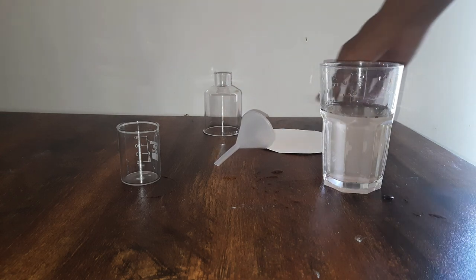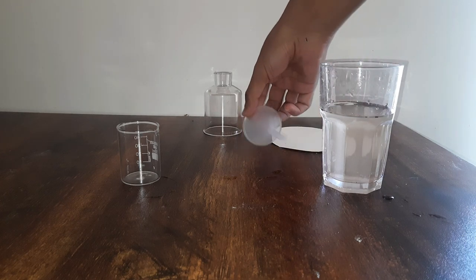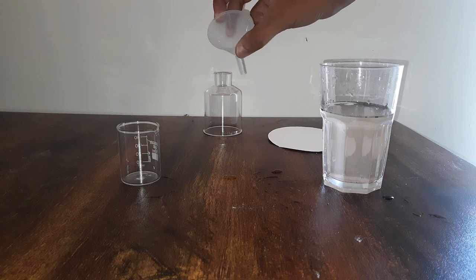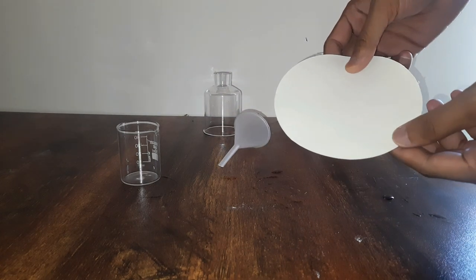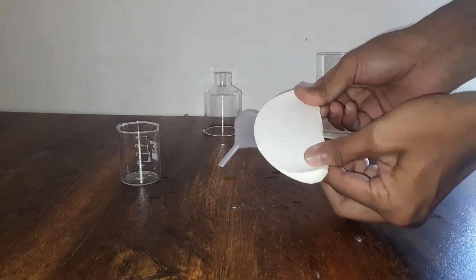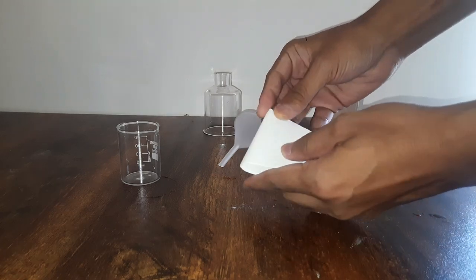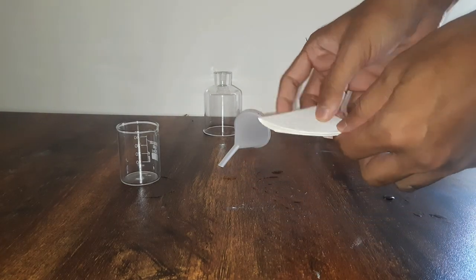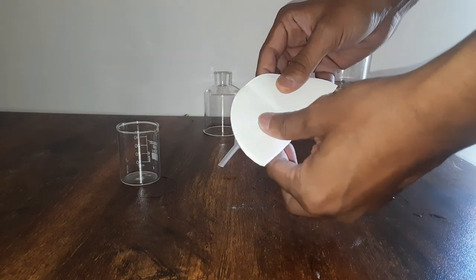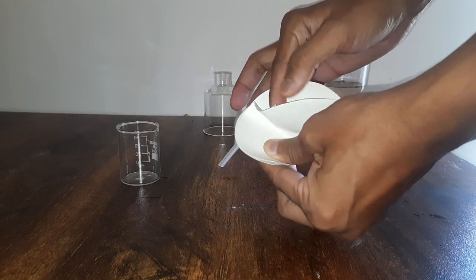As a first step, what we will do is fold this filter paper and try to fit it into the mouth of this funnel. To do that, we will first fold it in half, then fold it in half again. Now try to open it, and once it is half opened, we hold one part inside and put the other part outside, just like this.